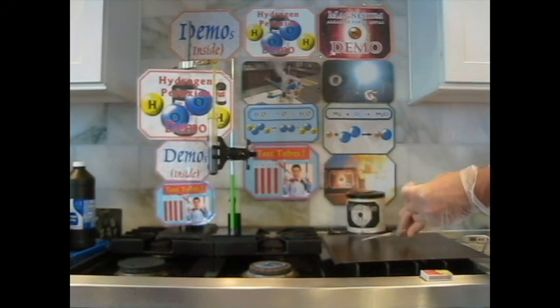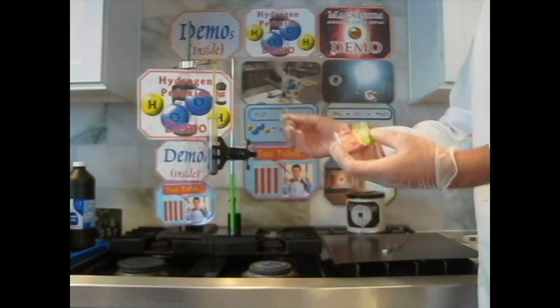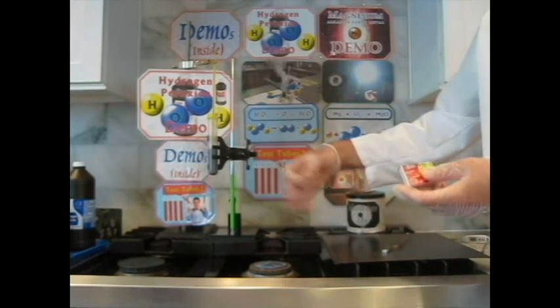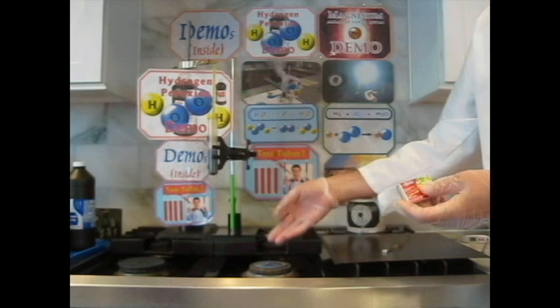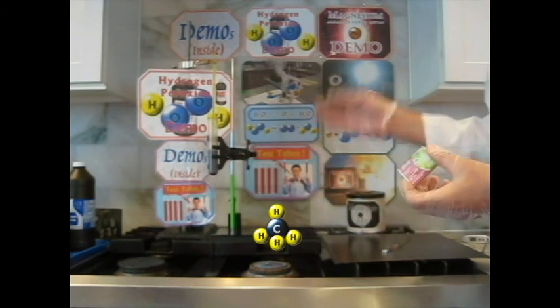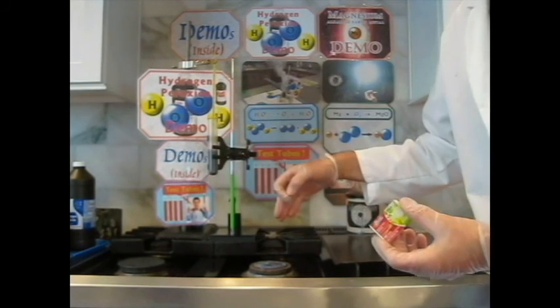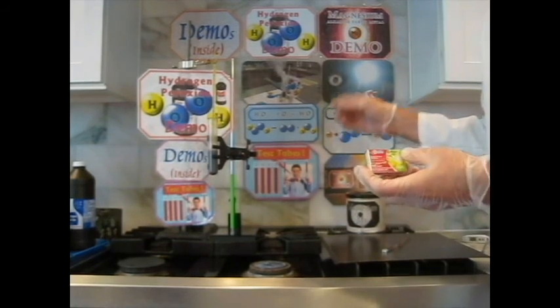Okay? So this is actually 3 reactions. One of them is lighting the safety match. The second one is burning the stovetop. Normally we would use Bunsen burners, but this is the same gas, the natural gas, mostly methane. By the way, methane doesn't smell. They put a little additive that really stinks so we can detect gas leaks. That's not the methane that you're smelling.